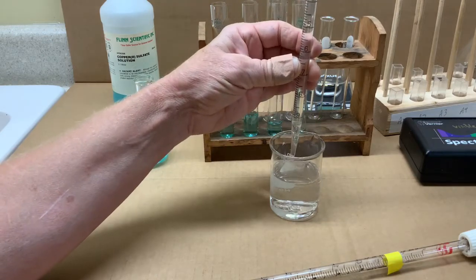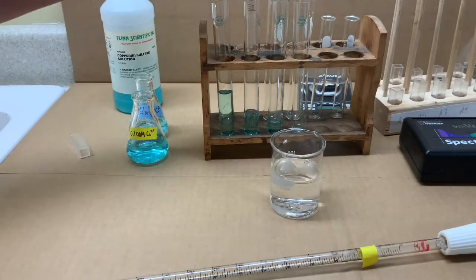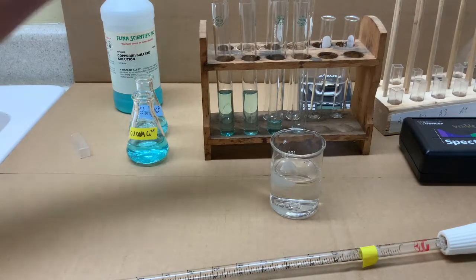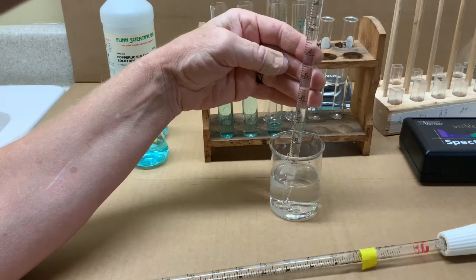And continuing along, 5 milliliters of water will be added to the 5 milliliters of stock solution, each time ending up with a total of 10 milliliters of solution.